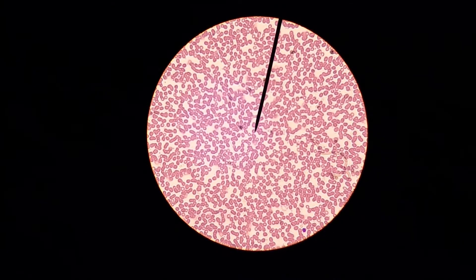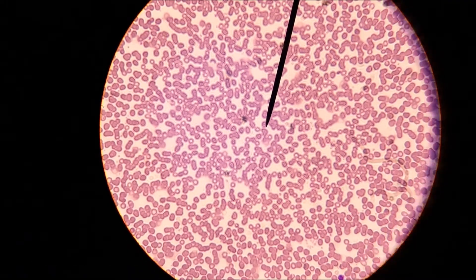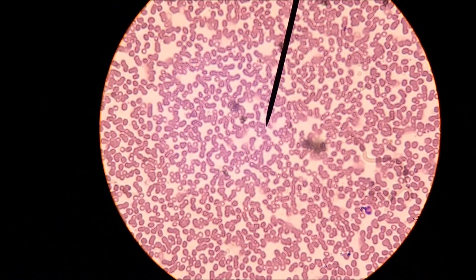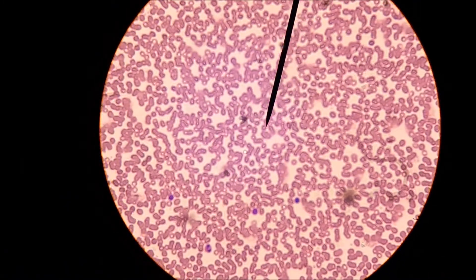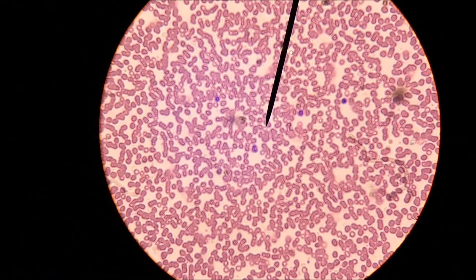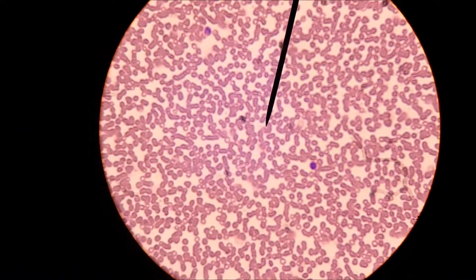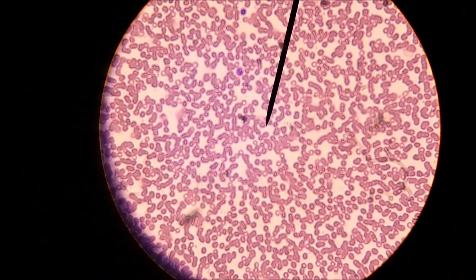Look at that. Now I'm having to look through my camera's lens to make things out. The individual cells I'm showing you here — if you can't tell, there's some debris on the slide or on the lenses — and that's a problem.